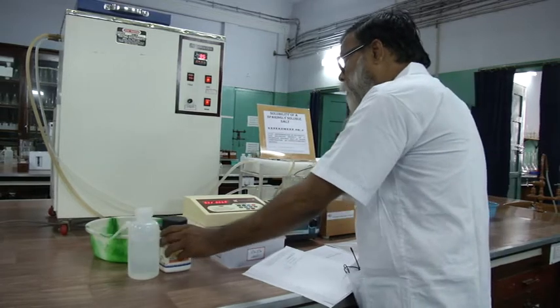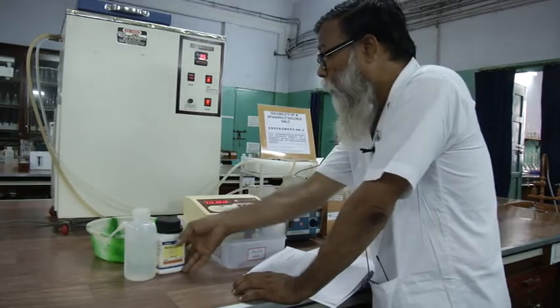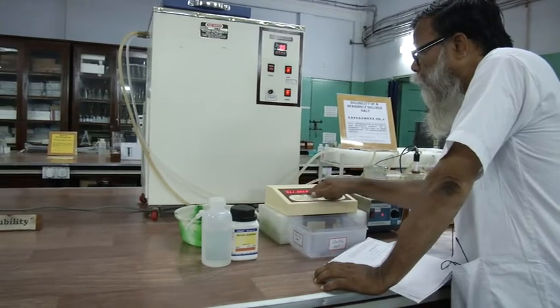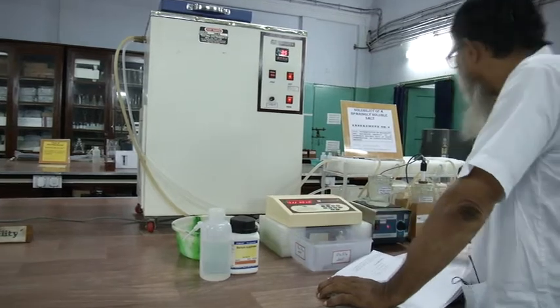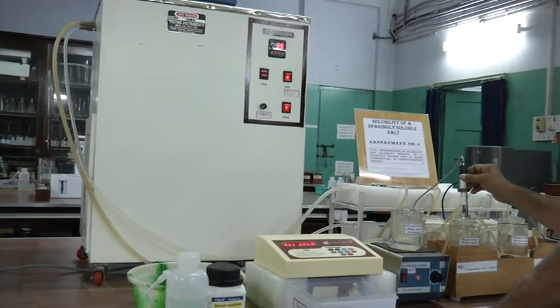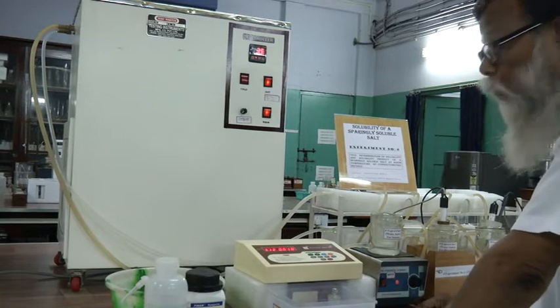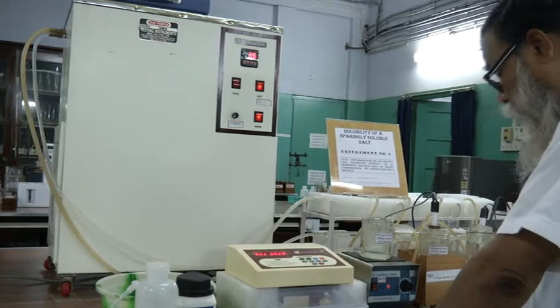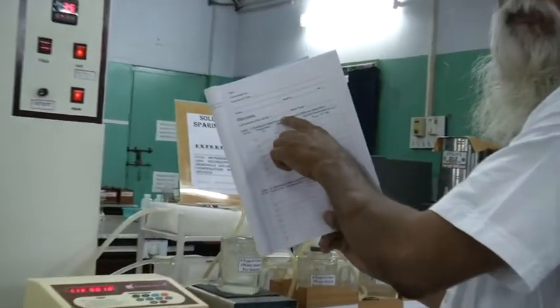You can get the reading directly from this meter. Now this meter, as soon as you put the switch on, will show a stored data. Now it is showing 1.1. This 1.1 is the cell constant of the cell. You know what is cell constant? L by A. It is showing the cell constant of the cell 1.12. So you have to note this one down. Okay. You need this cell constant in your manual. You have to write down the cell constant of the cell here.